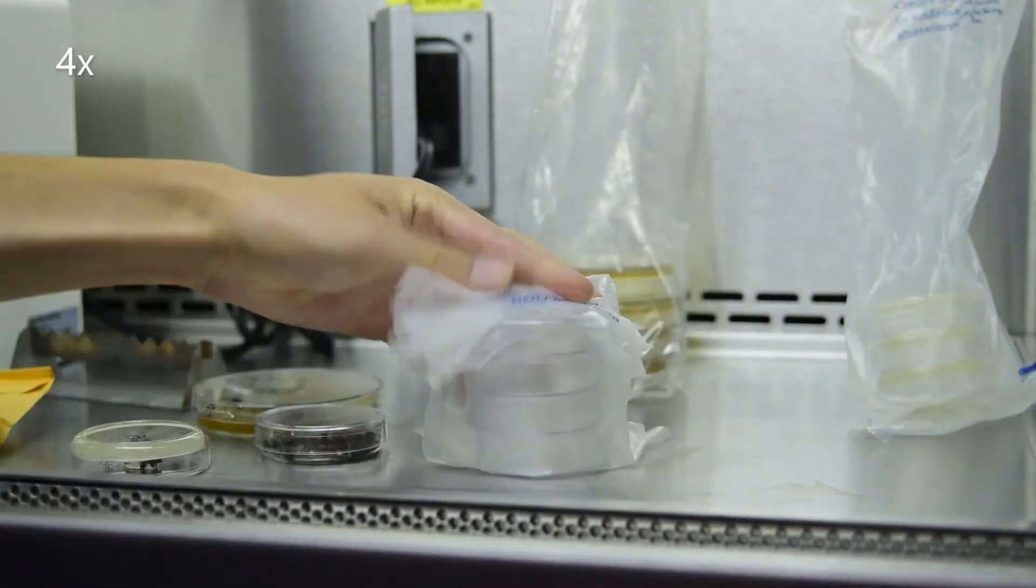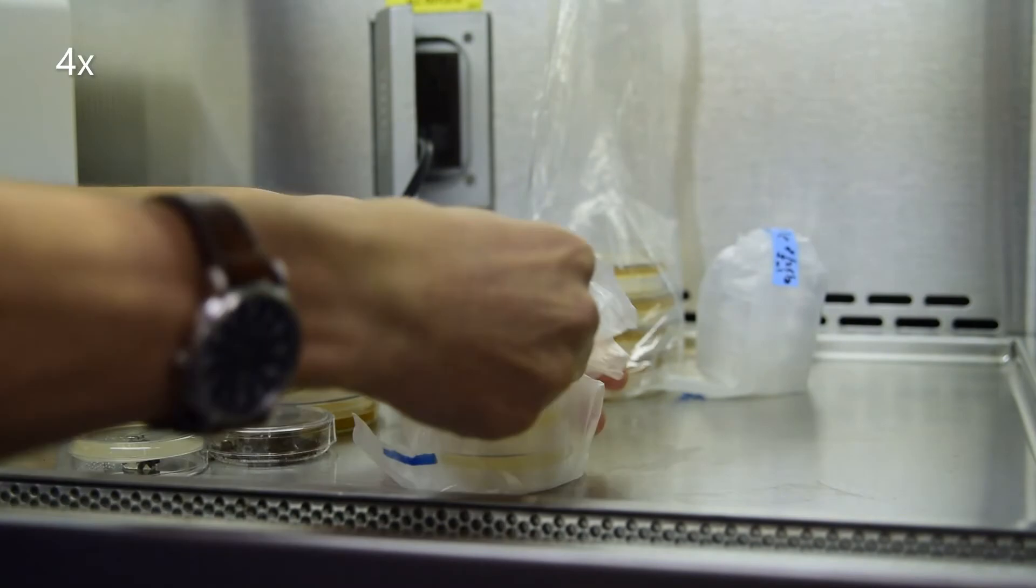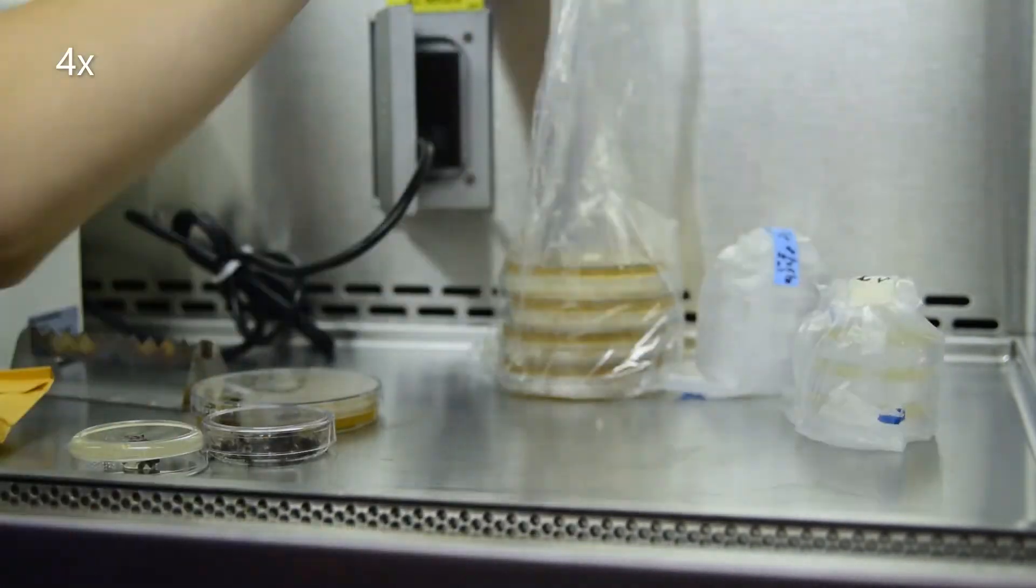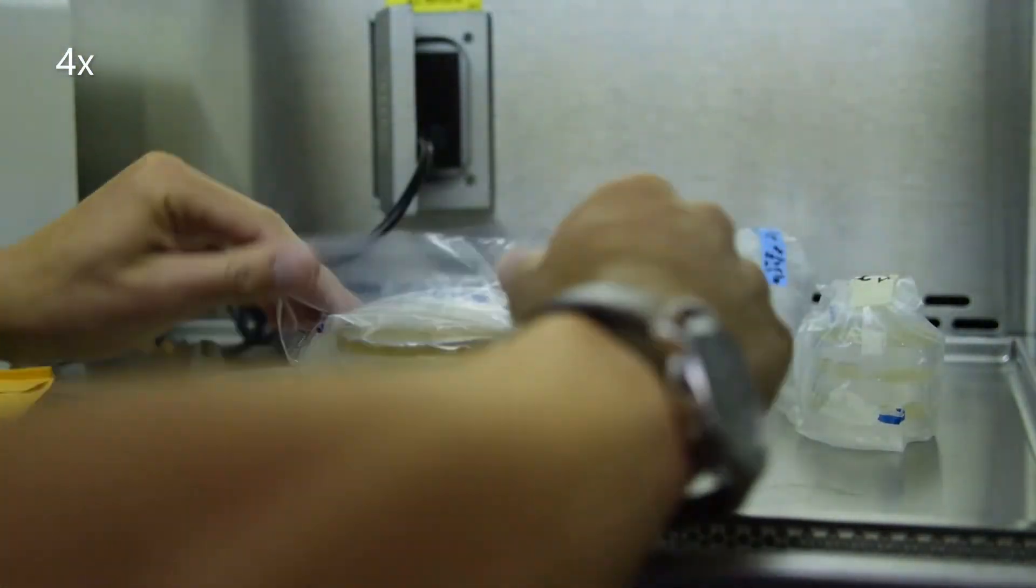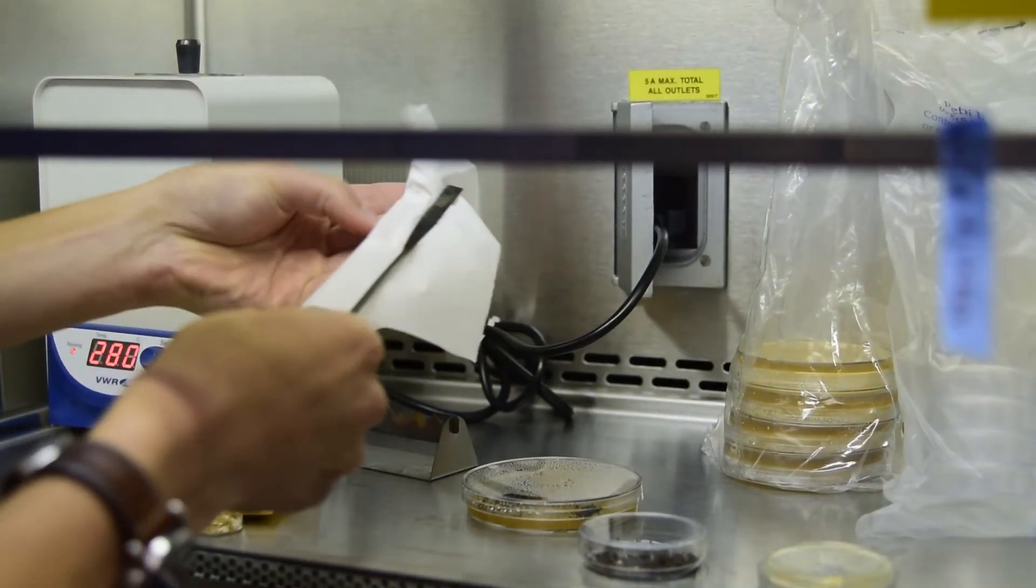Tightly fold the petri dish bags and set aside. Wipe the soil off the spatula and sterilize.